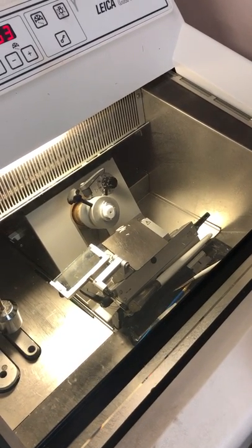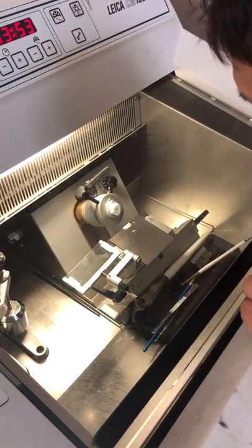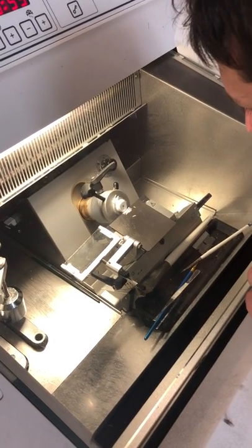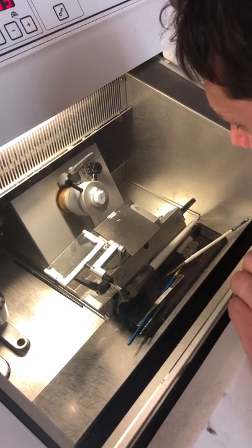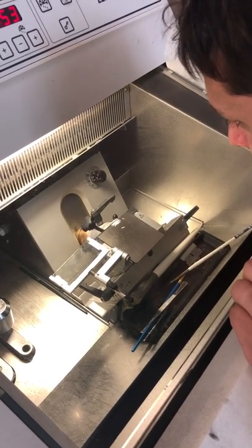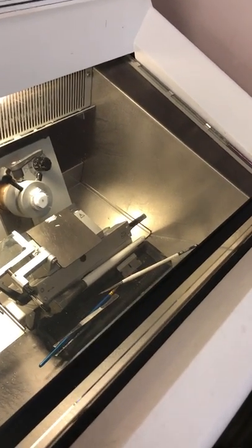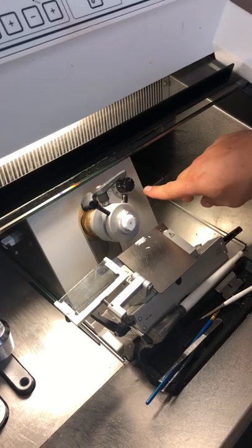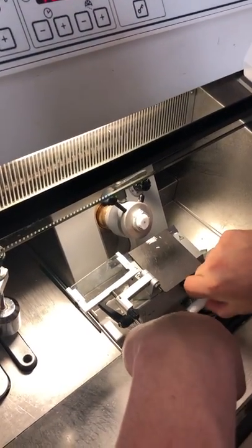We need to go back until the C shows up. Very close. You can see that it's open. So by that time, I used to come back — go to 18, 16. And then you can start cleaning this.